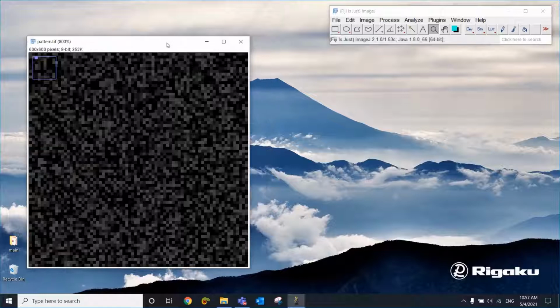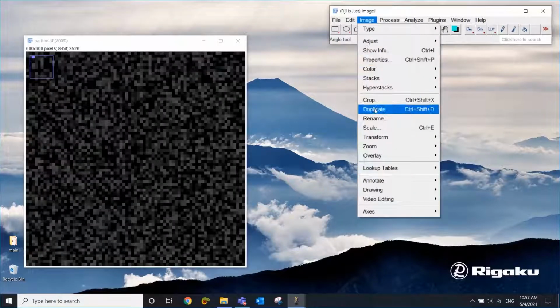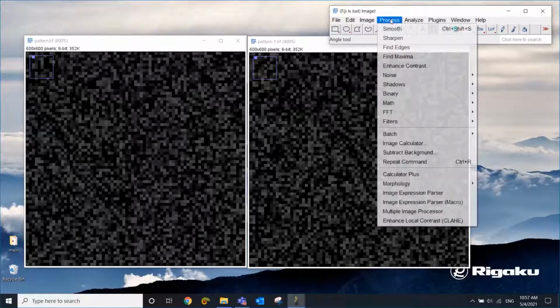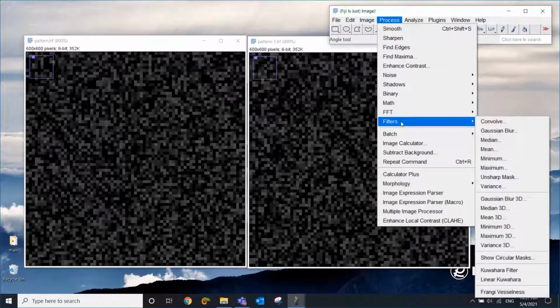Now, I want to keep this original image, so I'm going to go to Image and Duplicate to make another one. And let's zoom into about the same area. Okay, now to get rid of the noise, we are going to go to Process, and you can choose the Smooth menu, but this one doesn't give you a lot of choices, so instead we're going to go to Filters. Then you see a lot of different filters you can apply, not just smoothing.